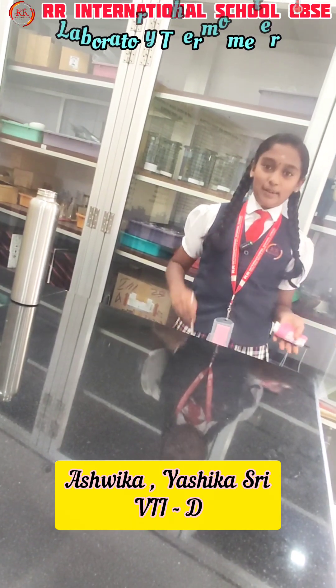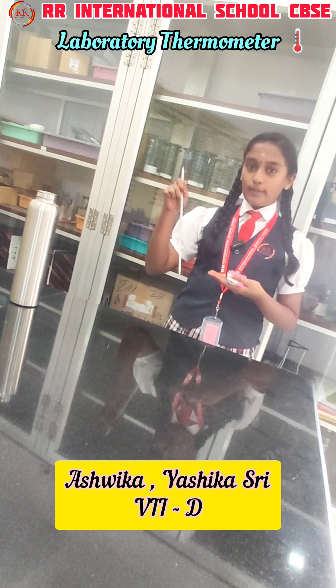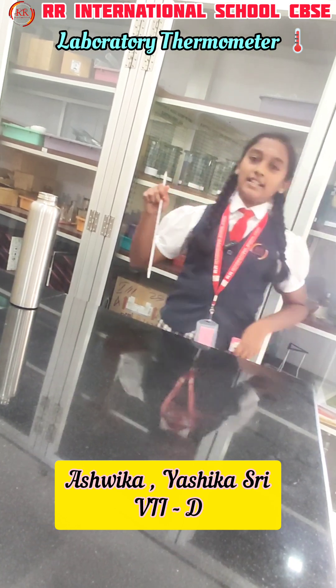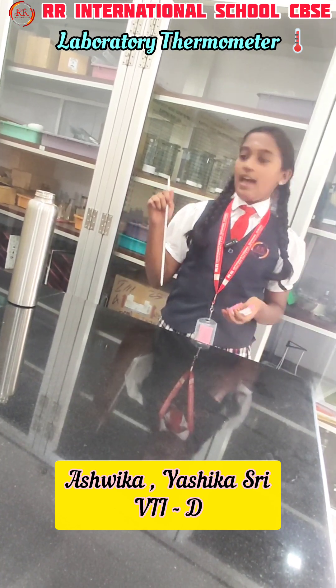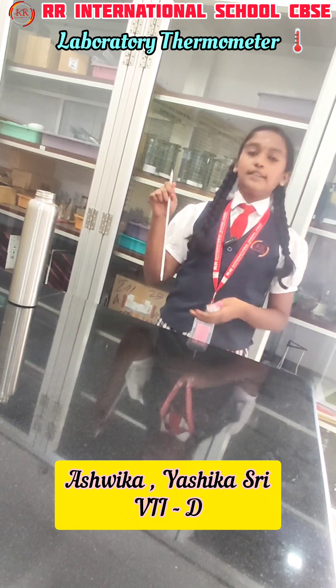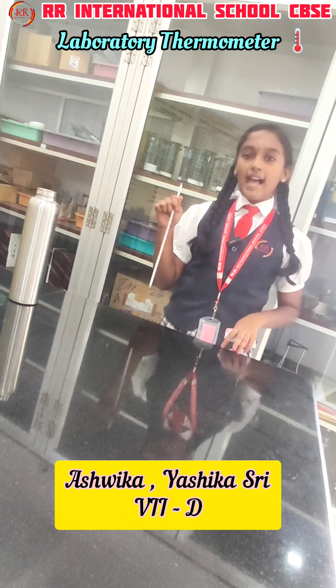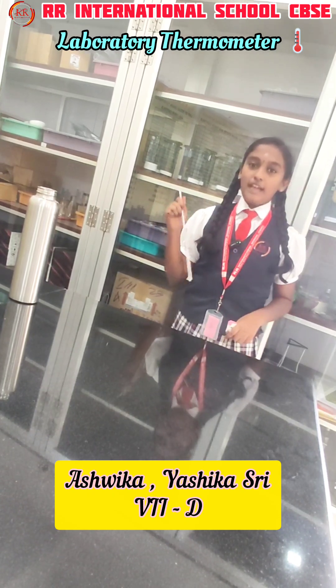I am going to explain about laboratory thermometer. This is laboratory thermometer. It is used to measure the temperature of other objects, and it is used in research centers, labs, schools, or colleges.